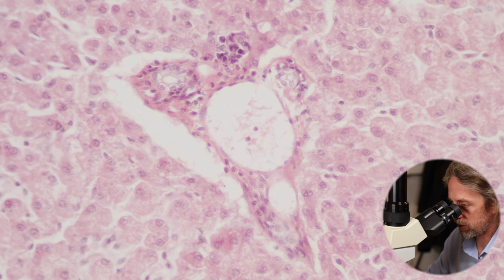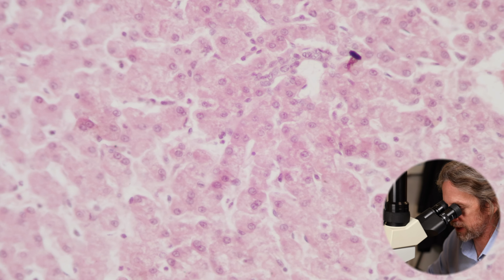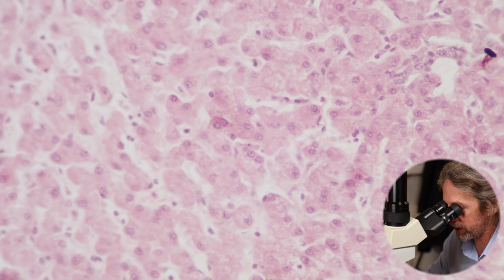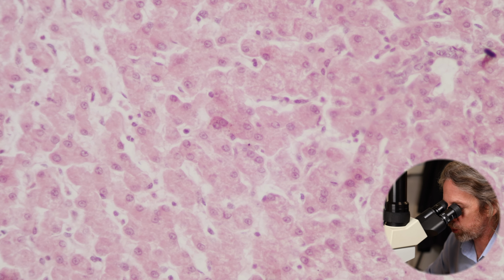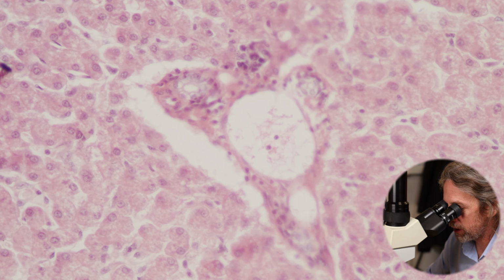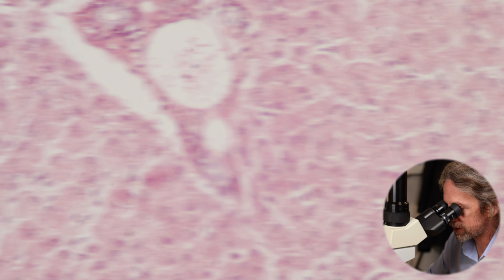Maybe you can see, don't forget, that space around it is probably artifactual from fixing and dehydrating the tissue. But if we slide over, what we're seeing is lots and lots of hepatocytes, and we can see channels between the hepatocytes. Can you see that the hepatocytes are pretty much no more than one row of hepatocytes thick? And this is what I was referring to when I said if your hepatocytes are your workers, they all need to be able to reach the conveyor belt. So the gaps between them will be the sinusoids, the channels that the blood is travelling through from the portal vein and the hepatic artery, and they'll be running across here. See if we can follow the flow. They'll be running to the central vein.